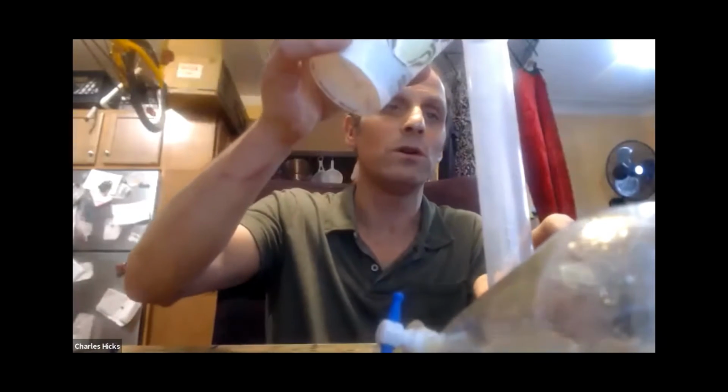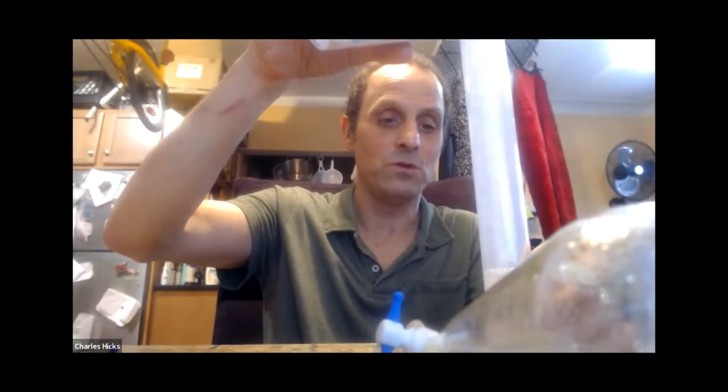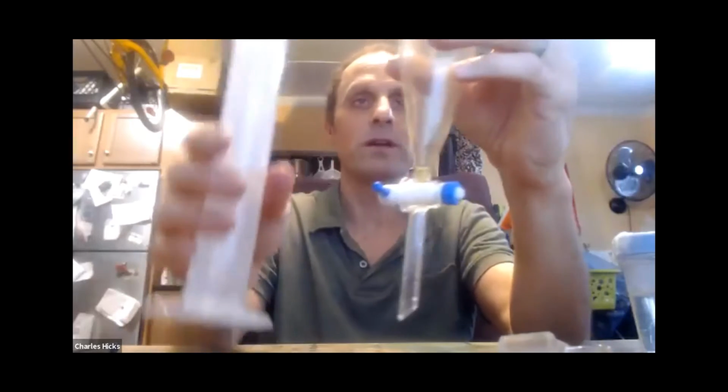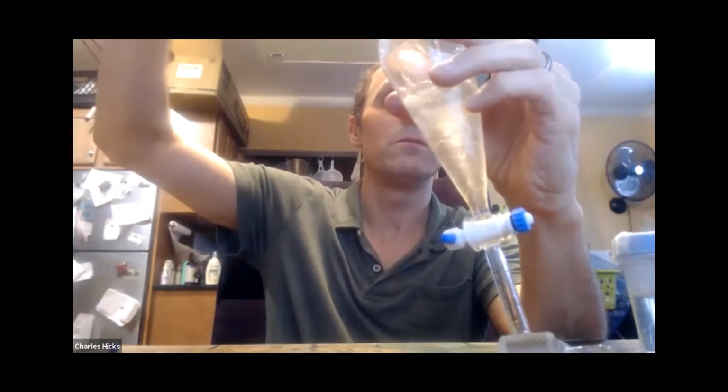The first thing that you have to do is to mix together 100 milliliters of water and 100 milliliters of canola oil. My separatory funnel is a little smaller than yours, so I'm only going to do 50 milliliters. But when you do the experiment, you're going to do 100 milliliters of each. Okay, so there's 50 milliliters of water. I'll make sure my valve is closed. It's perpendicular to the direction of fluid flow. And I'll put that in there.